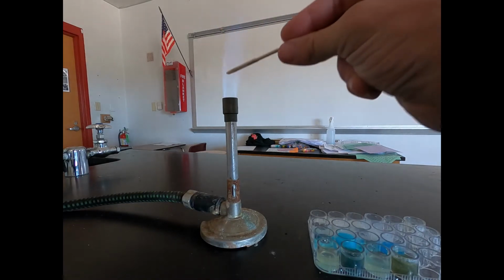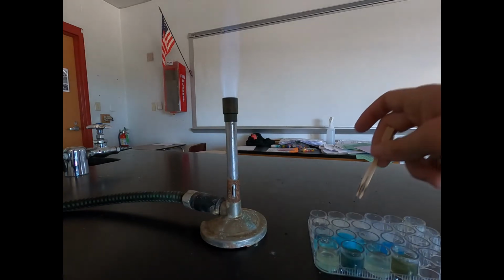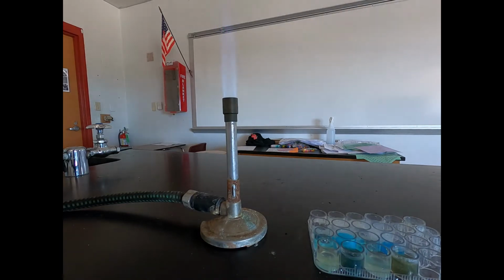You can see in this case we're getting a different color. We're not getting that bright orange we saw before. We're getting a kind of lighter yellowish color. I'll do that one again so we can see it. Kind of lighter yellow purple. It's an orange to purple color almost in appearance.